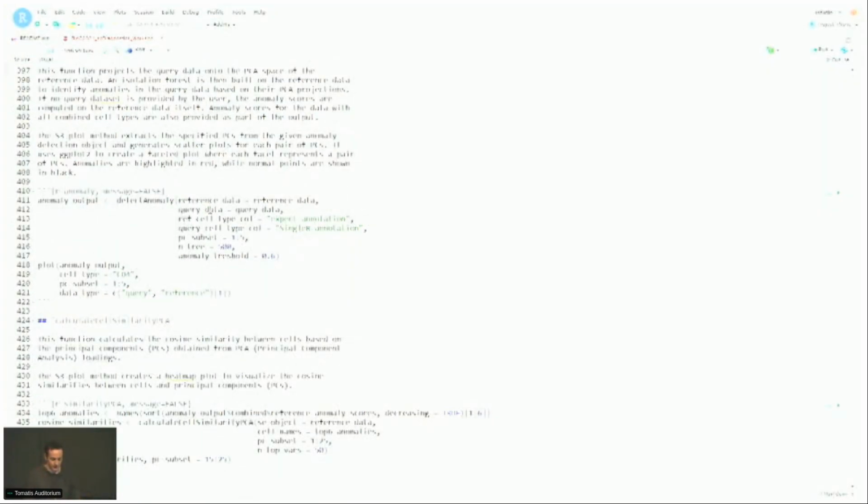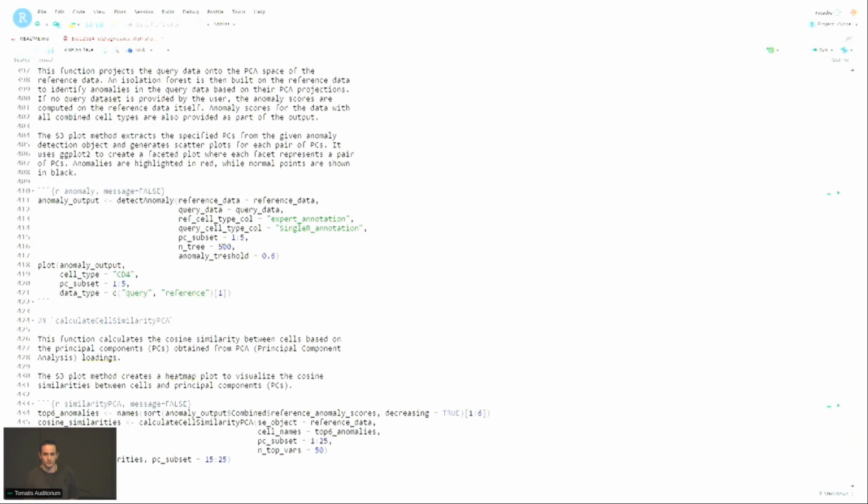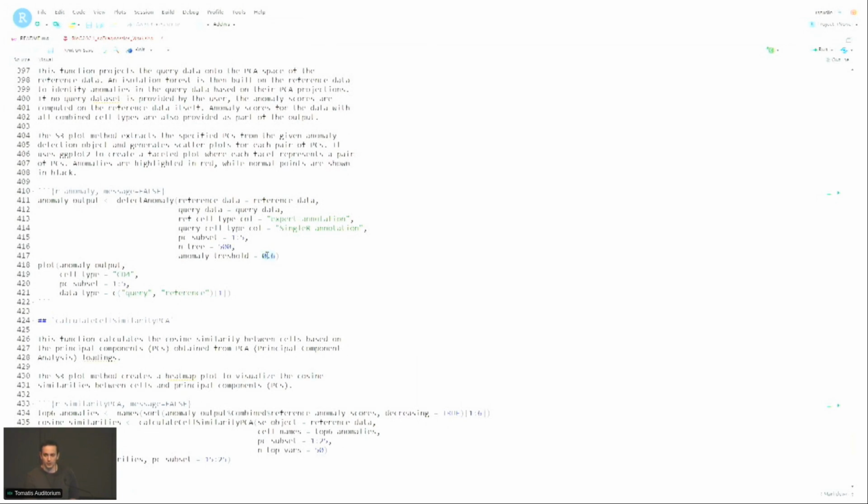So just as an example here, we have both a reference and a query. I'm going to use the SingleR annotation. And then there's a bunch of arguments you can use for detect anomaly. For example, the number of trees that are used for the isolation forest, and the anomaly threshold that you can adjust. I put 0.6, which based on my empirical experiments is usually a good value to use, but again, it's very data dependent. And then I'm going to plot the outputs.